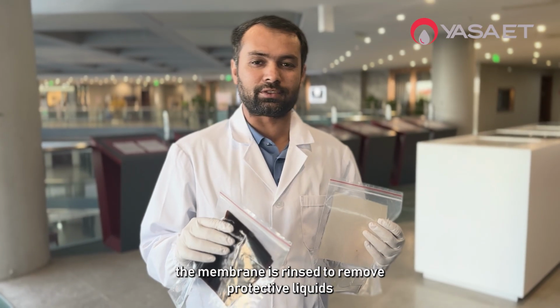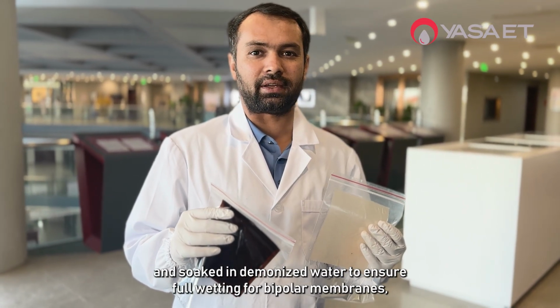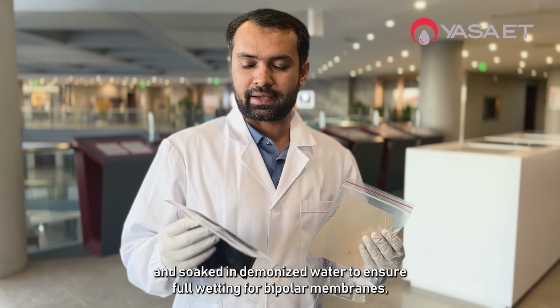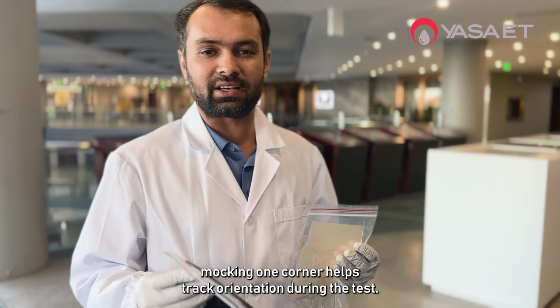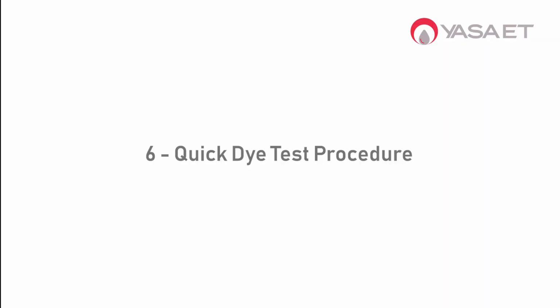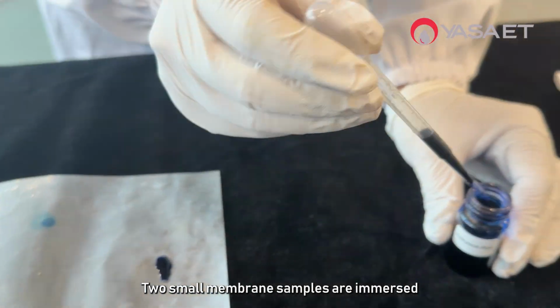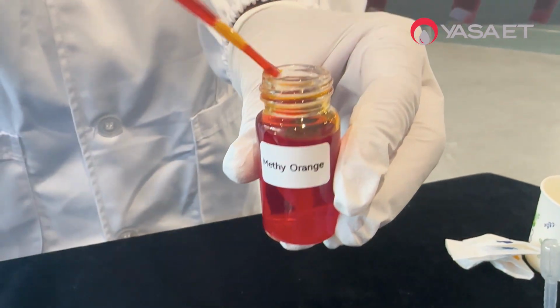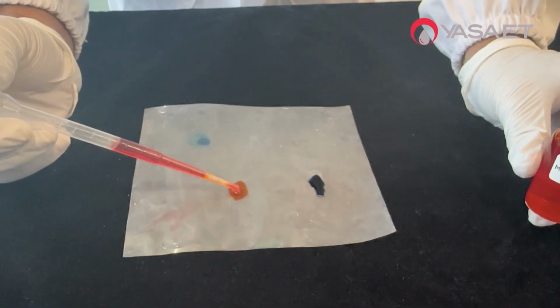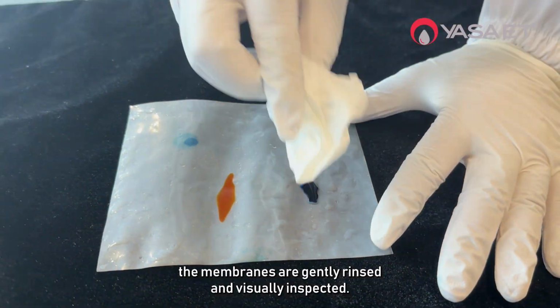Before testing, the membrane is rinsed to remove protective liquids and soaked in deionized water to ensure full wetting. For bipolar membranes, marking one corner helps track orientation during the test. Method A. Separate immersion. Small membrane samples are immersed separately, one in methylene blue and one in methyl orange. After 10 to 20 seconds, the membranes are gently rinsed and visually inspected.